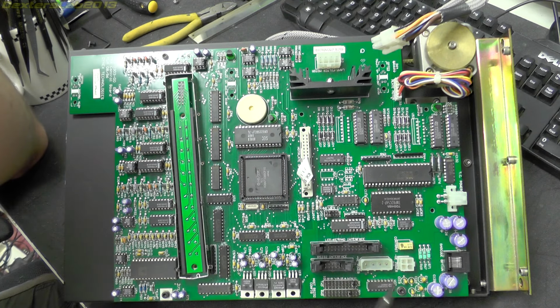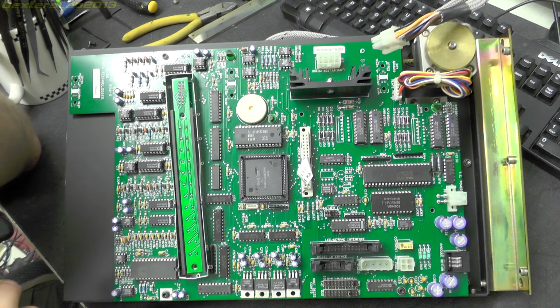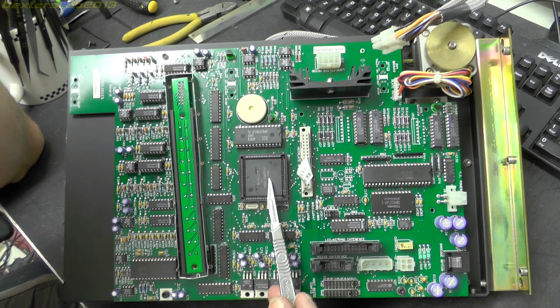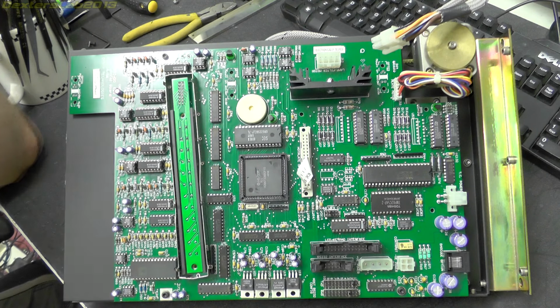Okay, this large device in the centre here is a Hitachi HD6473388CP10, which is a single chip microcomputer. So we have in here 8 16-bit registers, 16 8-bit registers, maximum clock rate 10 megahertz, which is what this one appears to be running at. Memory, this particular one, 338, has 48 kilobytes of ROM and 2 kilobytes of RAM.